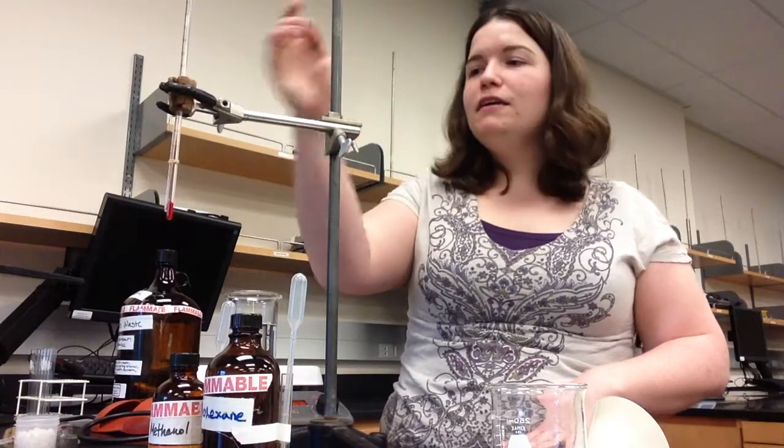After you've put away your waste, you need to clean up your lab bench. You will put the ring stand and the test tube clamps, things that you borrowed from the side of the room, back. Put things back in the cart, clean all of your glassware, put it into your lab drawer, lock your drawer, wash your hands, and you are ready to go.